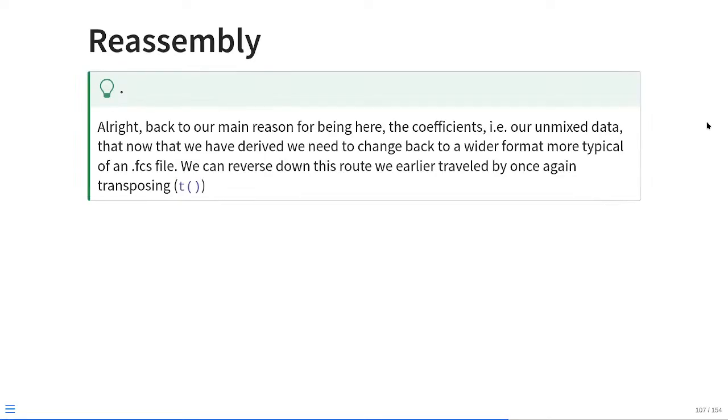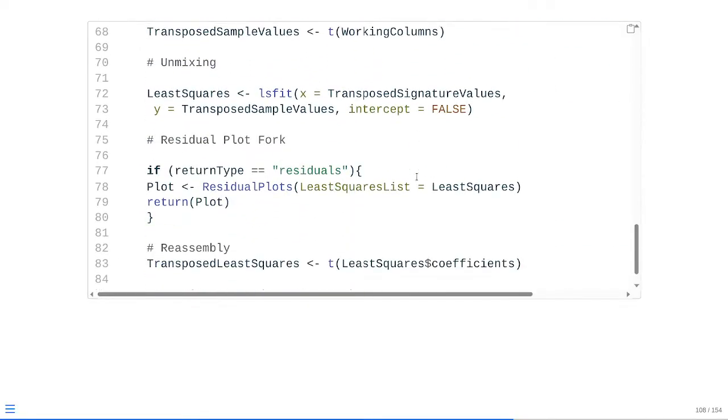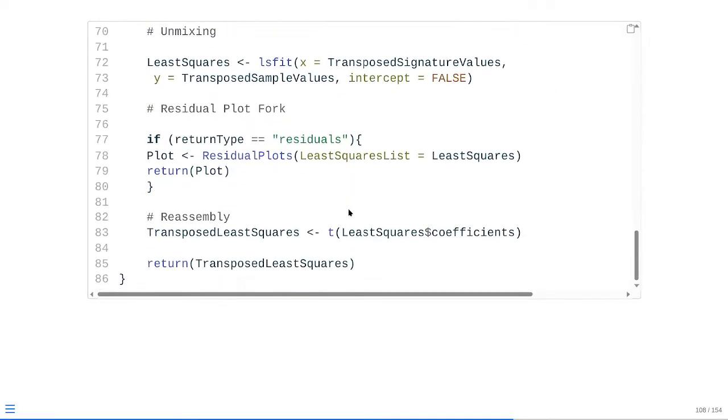Alright, so our main reason for being here, the coefficients, i.e. the unmixed data, let's go ahead and turn back to them. So you remember we had to pivot from a wide format to a long format to be able to carry out the unmixing. If we want to be able to put them back into the expression slot, we're going to need to pivot back to a wide style format, so we're going to need to retranspose them all again. So at that point, as we scroll downwards, we're now back into trying to fit everything into the correct format, so we're just going to call this little comment line reassembly.